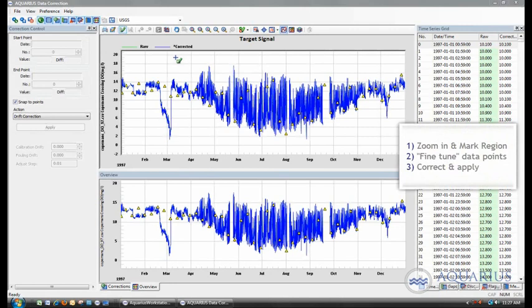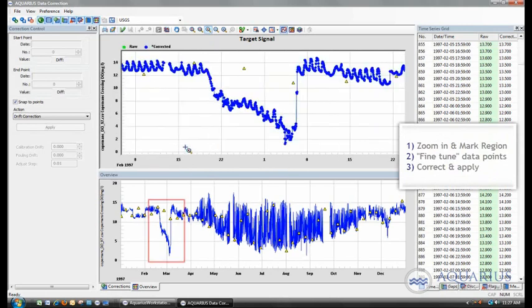The procedure is always going to remain the same, and I'll run through exactly what that procedure is. Now, one thing you need to do is basically zoom into that particular region that you're interested in. So I'm going to select my magnifying glass and move in and highlight that region. So this is the overview pane, and we can see that we've zoomed into that section. Now, the second step is to basically tell AQUARIUS that we're interested in this region of data. We do that by clicking the Mark Region button and then selecting within this target signal pane this section of data.